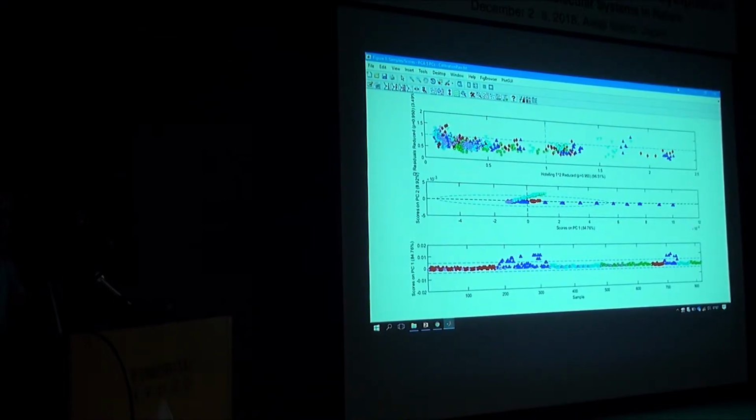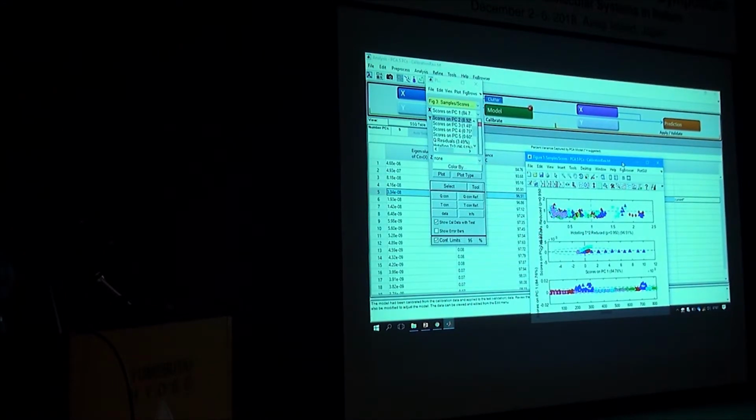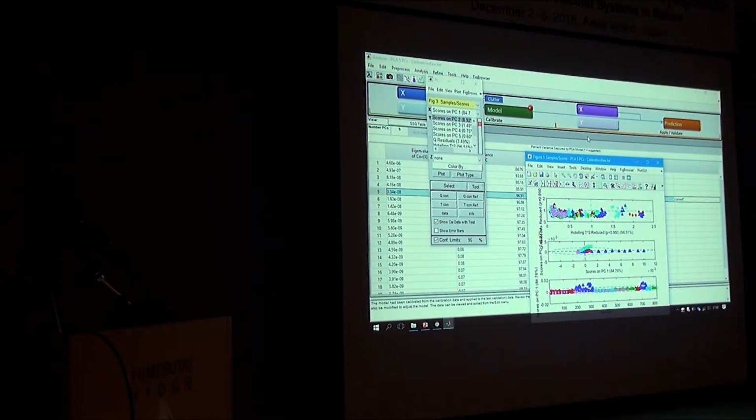So all this was done with the potassium chloride data mixed in. You can remove that and the picture will be more interesting. Or you can just focus on the water spectra. That's what was done in that EMSC work. They just focused on the water spectra, took the first principal component of the water spectra, and just subtracted that in EMSC.